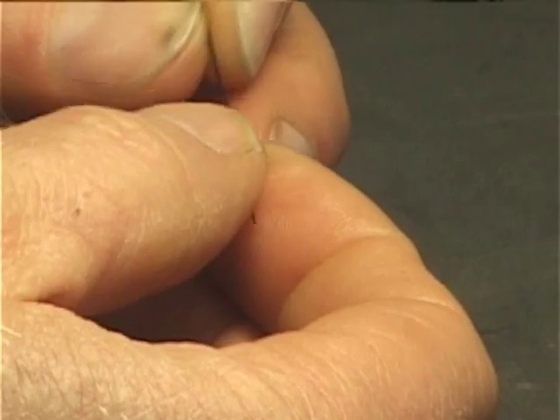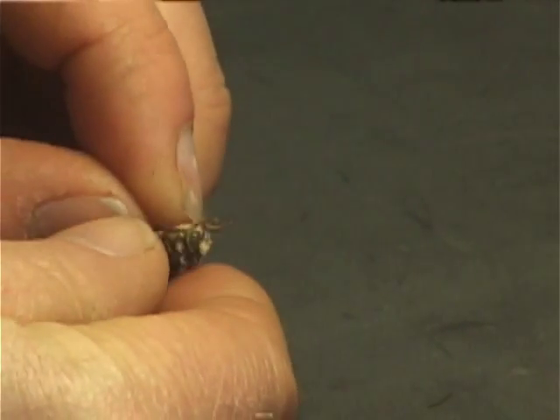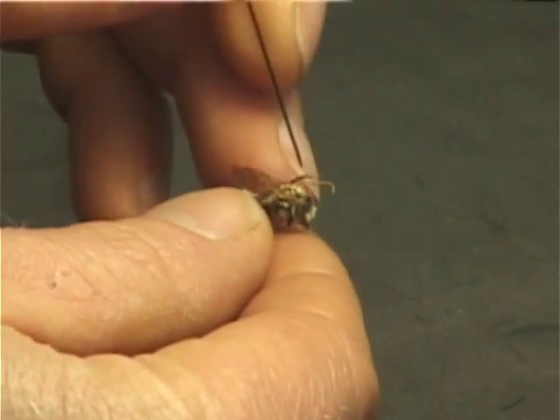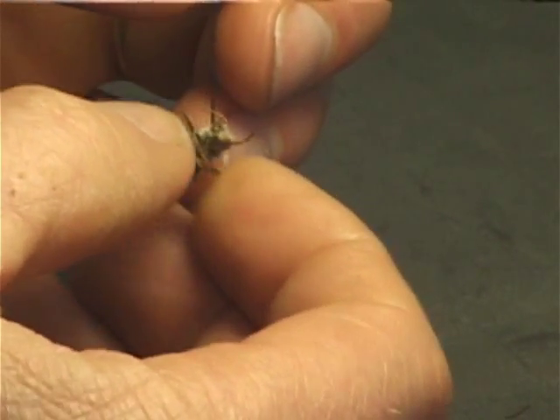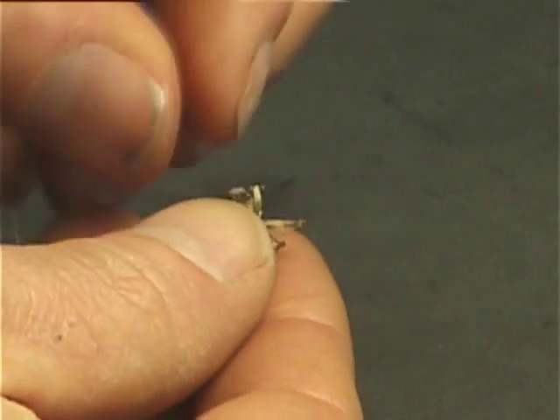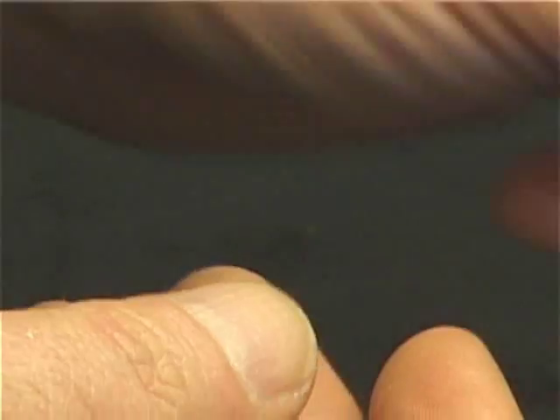After you insert the pin into the specimen, I hold the specimen between my thumb and forefinger in one hand, and with the other hand I have the pin. I take my middle finger and press against the bee specimen. I place the pin into the top part of the specimen in the right position, move it partway through, and either use my fingers to slide the specimen up near to the top of the pin, or particularly with small specimens, I jab it into the styrofoam to get the pin partially through, and then it's easier to run up to the top.